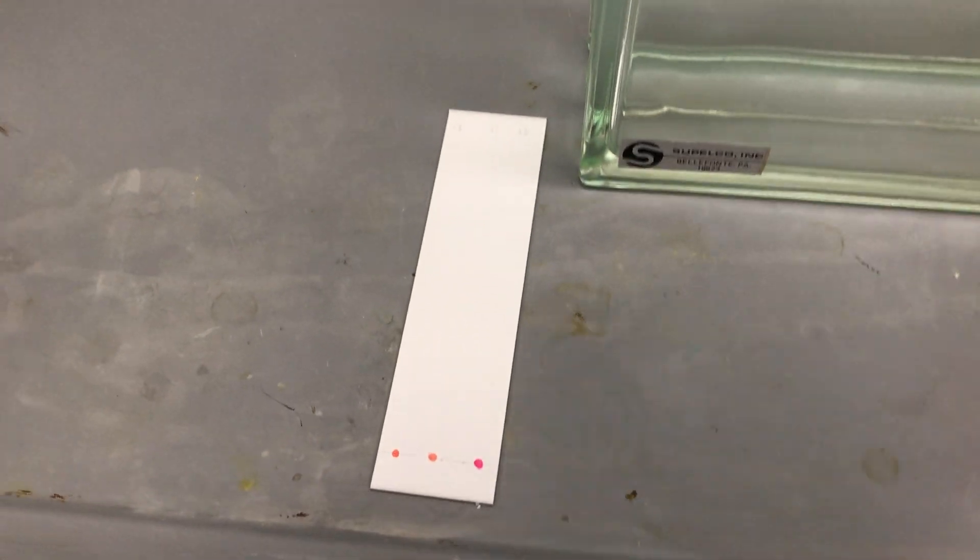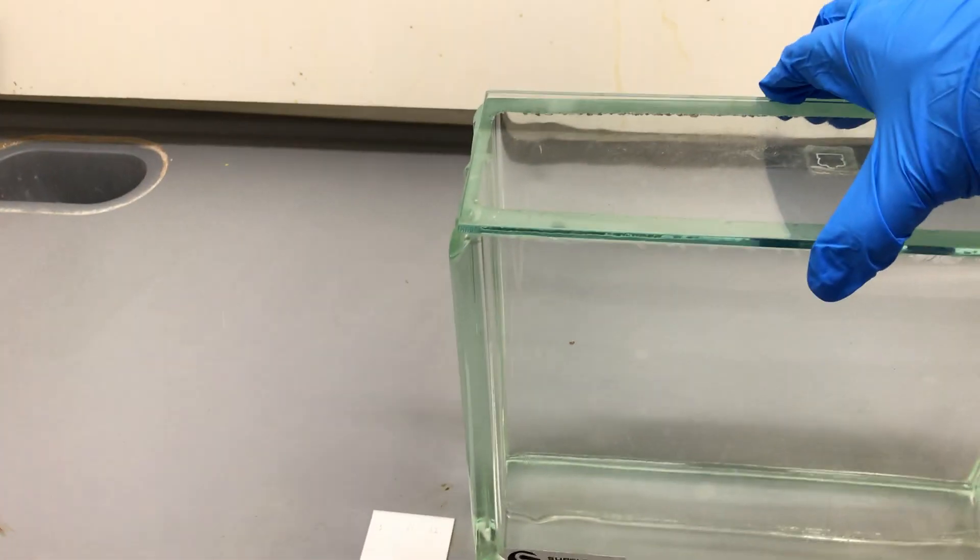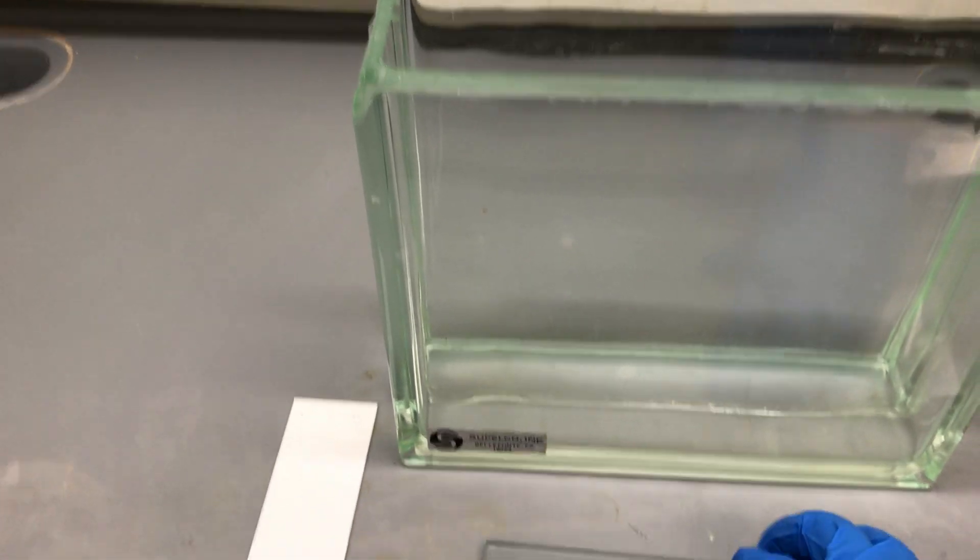But to do that first we have to put it in the tank. So let's do that. So first we're going to remove our top from our tank. It's very stinky, that's why it's in the fume hood.